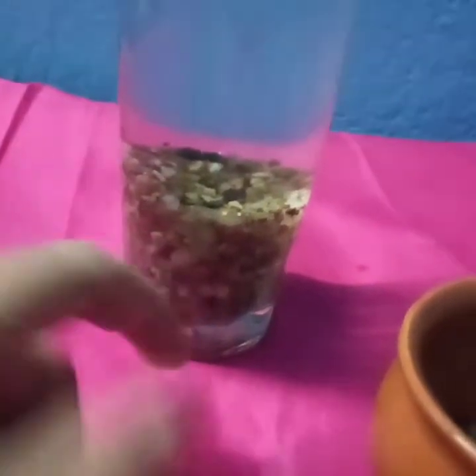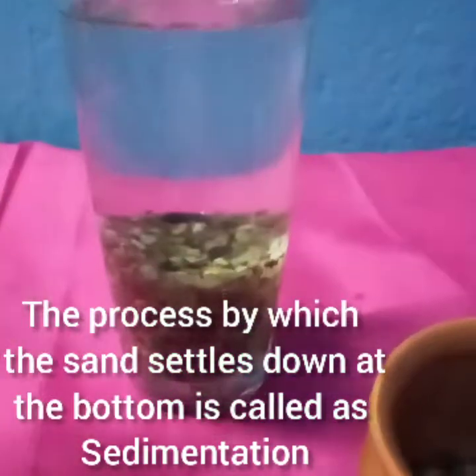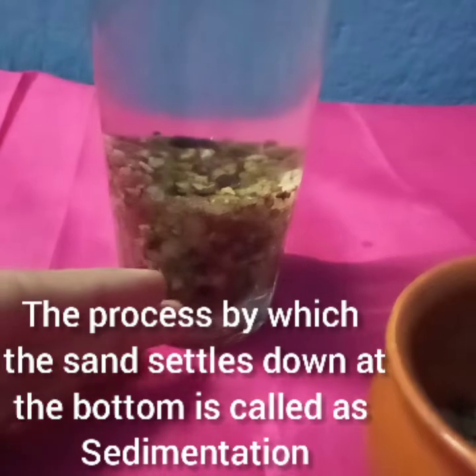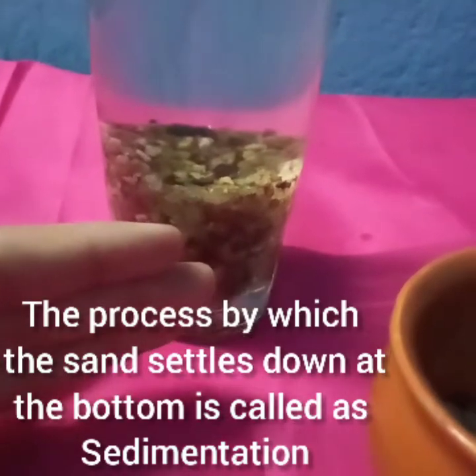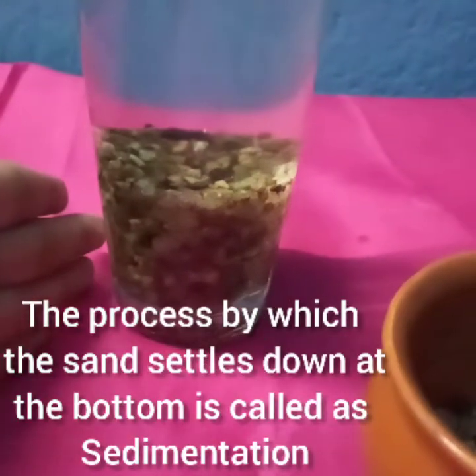The process by which the sand settles down at the bottom of the container, this container is a glass, is called sedimentation. So this is called sedimentation.